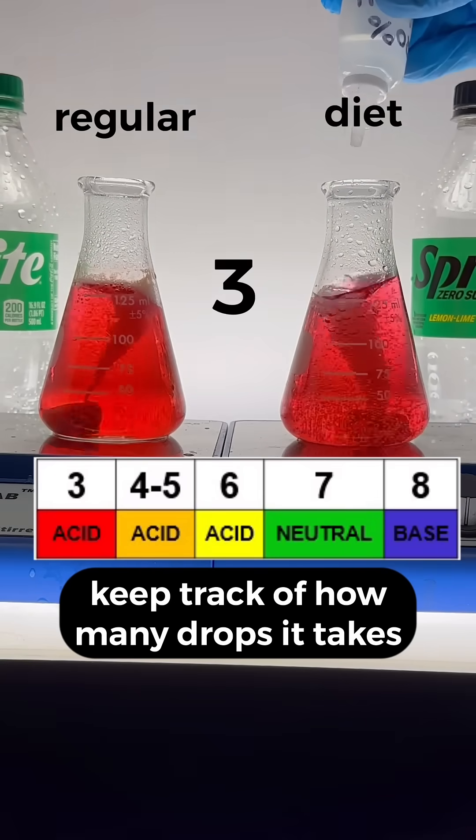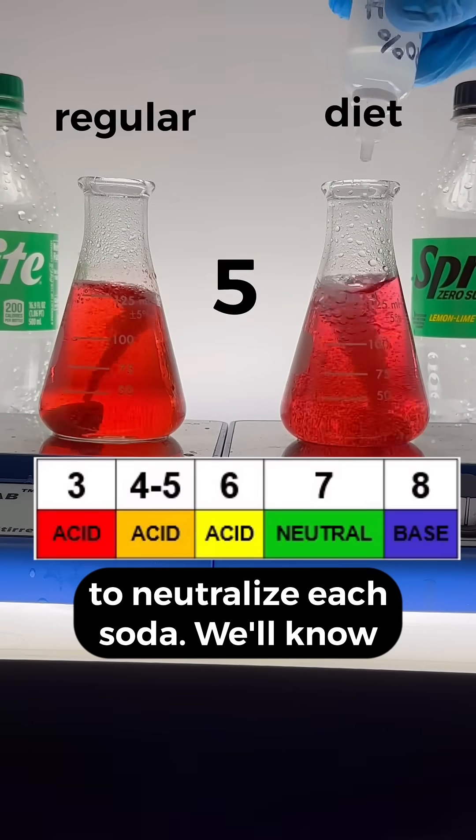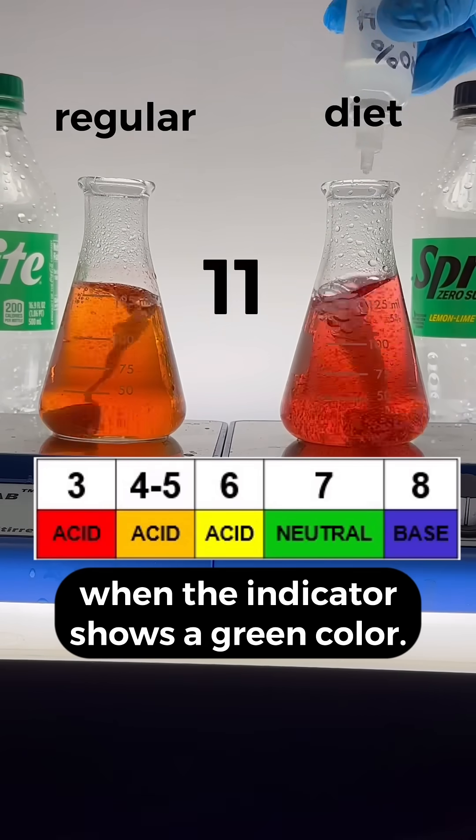Let's keep track of how many drops it takes to neutralize each soda. We'll know that each soda has been neutralized when the indicator shows a green color.